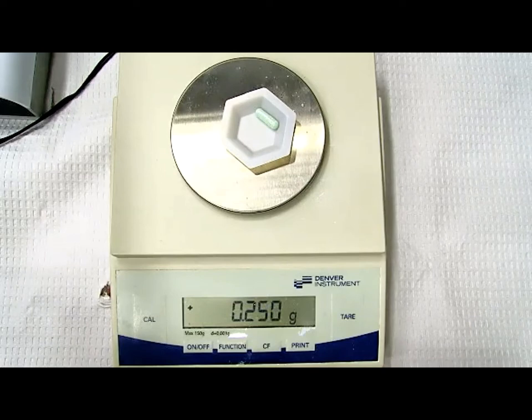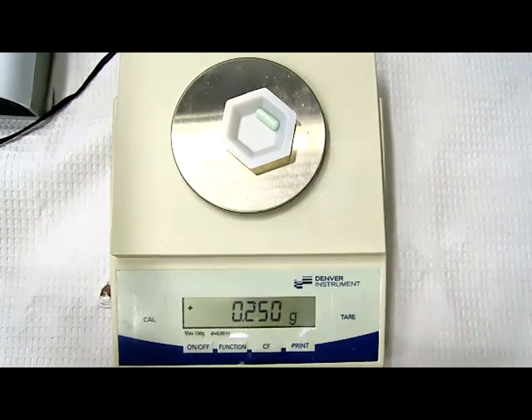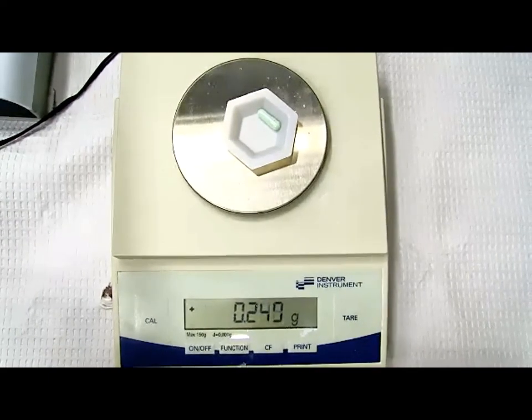Let me just say this. In your QA section, you have to write the individual capsule weight. Every capsule that you end up dispensing, you have to write the individual weight down. However, we've still got 2 more things to do before we document the weight. This is not quite ready to be dispensed yet.